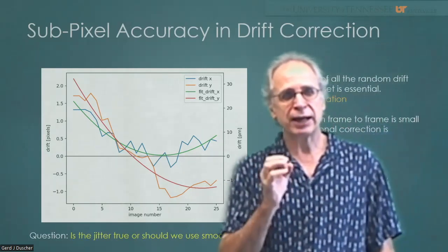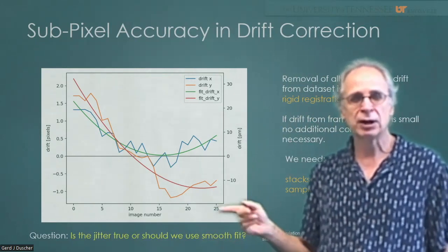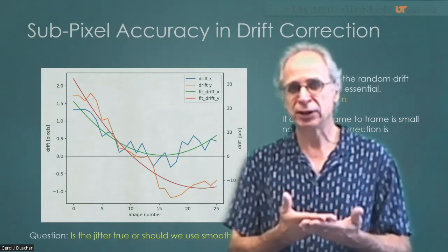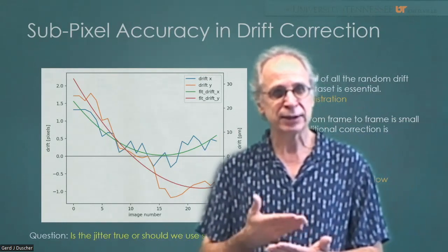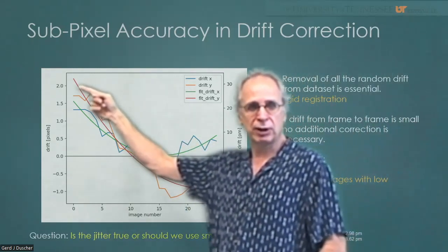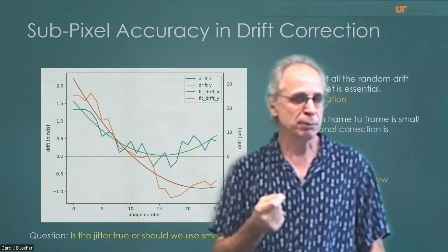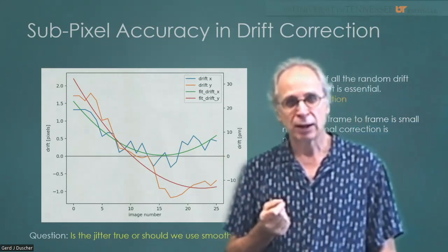And let's look at the quantity of that. We have 25 images that we acquired relatively quickly. If you acquire an image stack, the single images should be able to be cross-correlated. So there needs to be some information in there in the Fourier transformation, so you can check that out. It should, on the other hand, be acquired fast enough so that you have very little drift from one image to the other. In our case, within 25 images, we got a total of 3 pixels in the Y and 2 pixels in the X direction. So that was very, very stable. And you cannot normally reach that kind of precision or stability with a side entry holder.